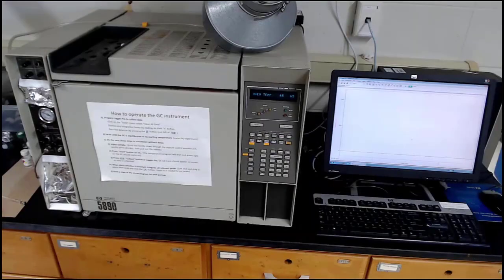Finally, we'll be analyzing the reaction mixture by gas chromatography, or GC. GC was covered extensively in a previous video. If you're a little fuzzy on how it works or how to operate the GC instrument, check out that prior video and remind yourself of how it all works. Here we're just going to go over the basics and review the general operation.